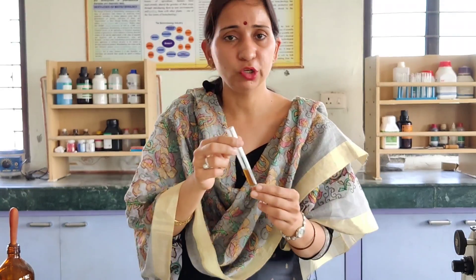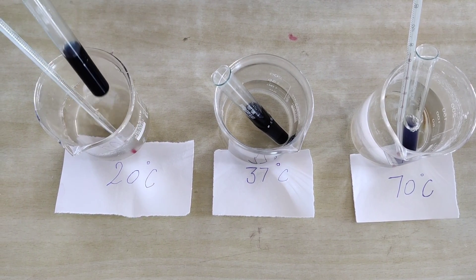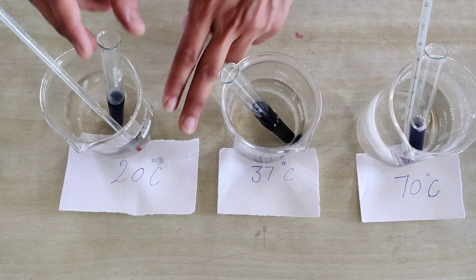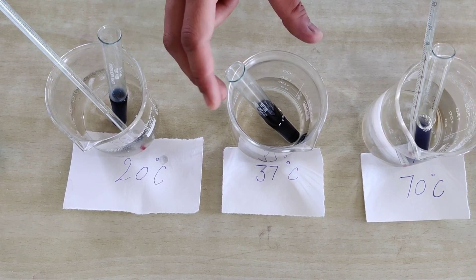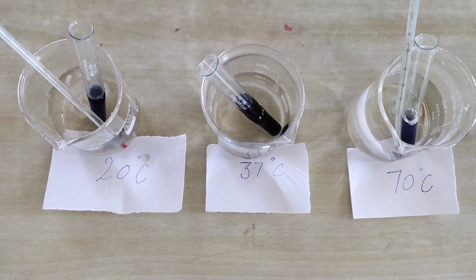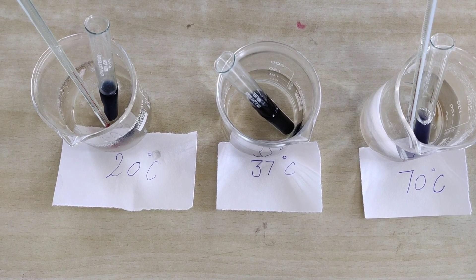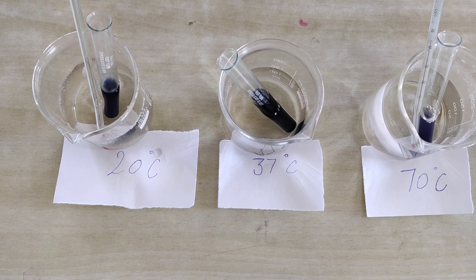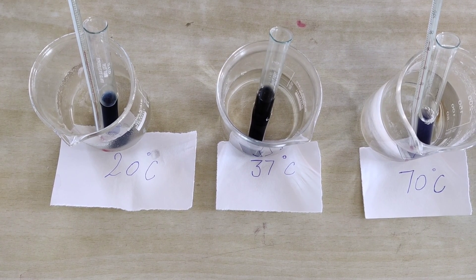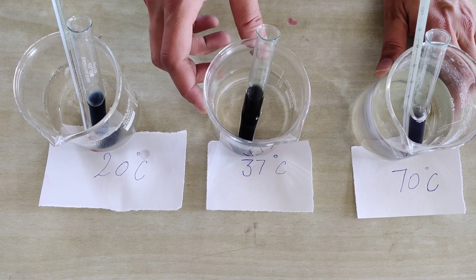In this experiment we also perform the activity of salivary amylase at different temperatures. We have kept test tubes containing starch solution with salivary amylase at different temperatures: the first beaker at 20°C, the second at room temperature which is 37°C, and the third beaker with hot water at almost 70°C. Thermometers are placed in each beaker to maintain the temperature.